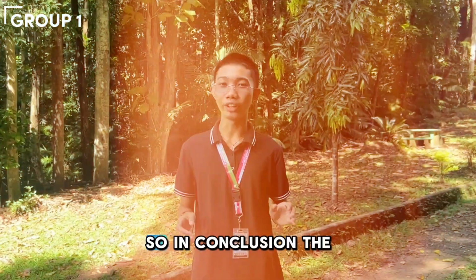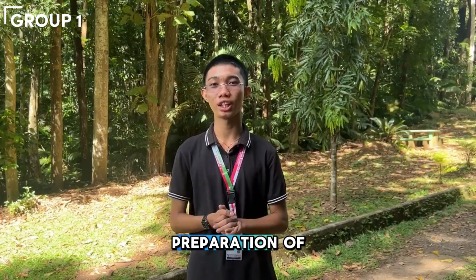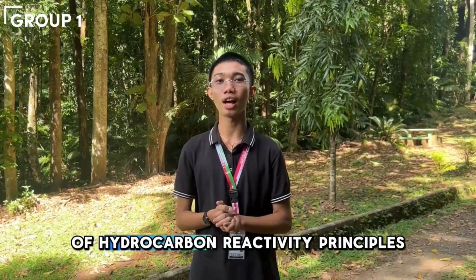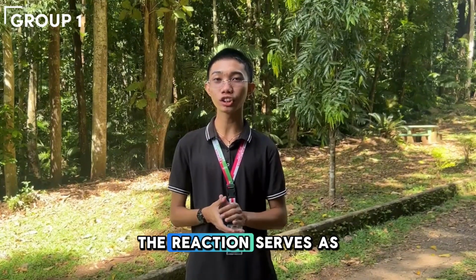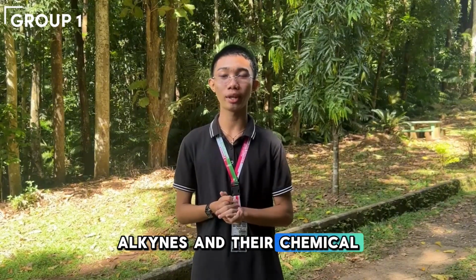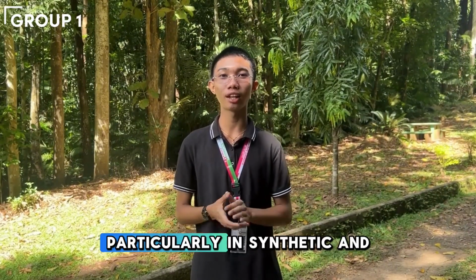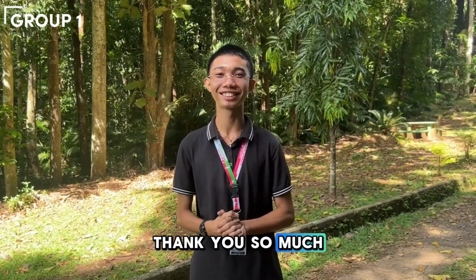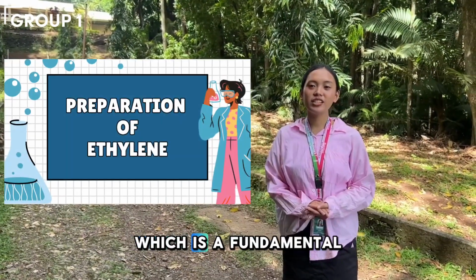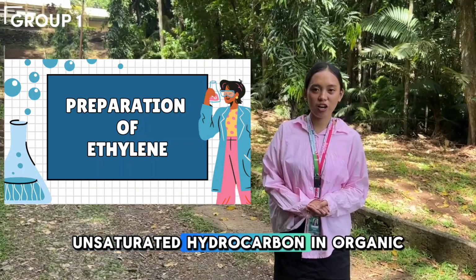So in conclusion, the preparation of acetylene highlights the practical application of hydrocarbon reactivity principles. The reaction serves as a foundation for studying alkynes and their chemical properties, particularly in synthetic and analytical chemistry. Thank you so much. Now, I will discuss the preparation of ethylene, which is a fundamental unsaturated hydrocarbon in organic chemistry.